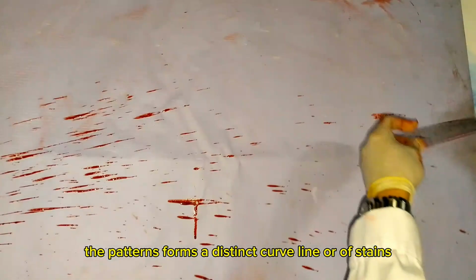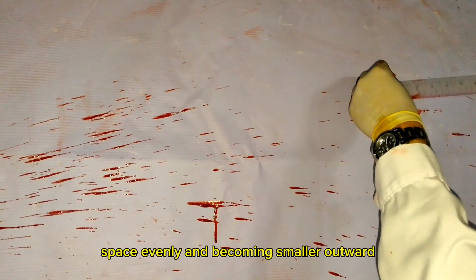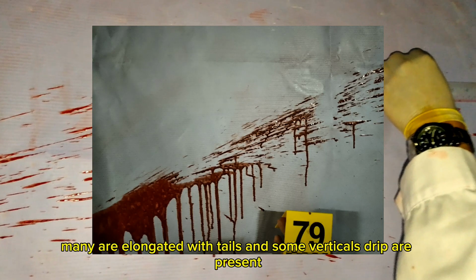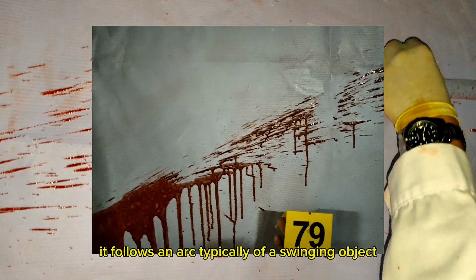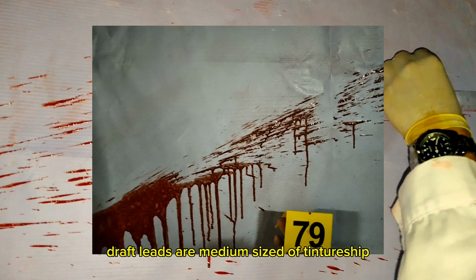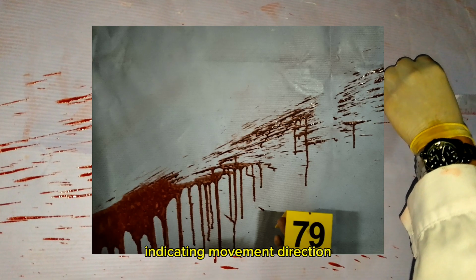The pattern forms a distinct curved line of stains spaced evenly and becoming smaller outward. Many are elongated with tails, and some vertical drips are present. It follows an arc typical of a swinging object. Droplets are medium-sized, often tear-shaped, with tails pointing right, indicating movement direction.